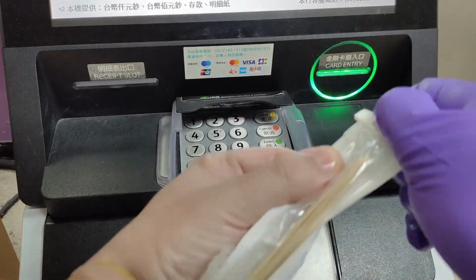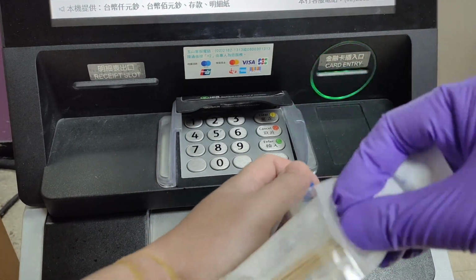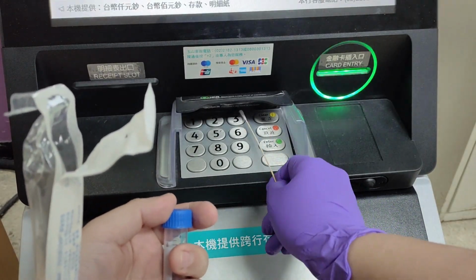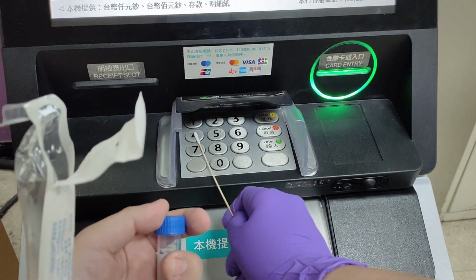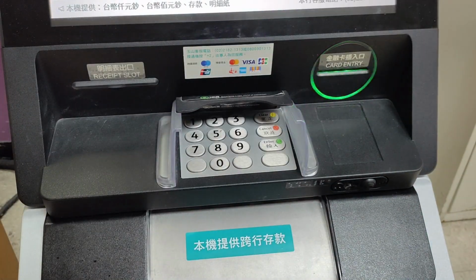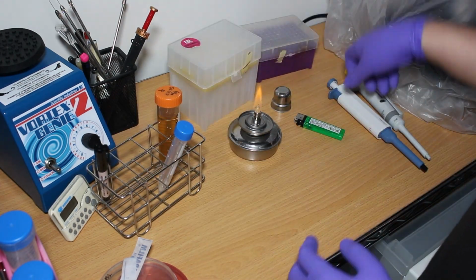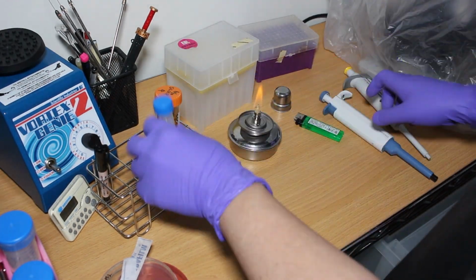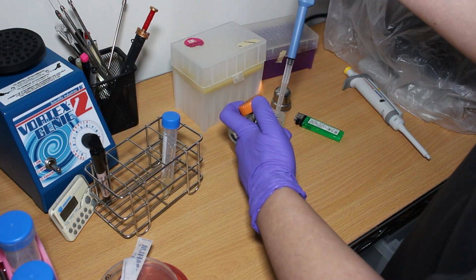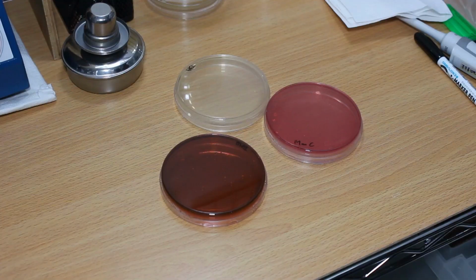First, I take a sample from the button on the ATM, since the screen area will be too large for my sampling. I use a sterilized cotton swab after soaking it in sterilized saline to sample from the button. Then the cotton swab is brought back to the home lab, adding 2 ml of SCDLP medium and shaking for 30 seconds to wash down the bacteria, then spread onto a culture plate.